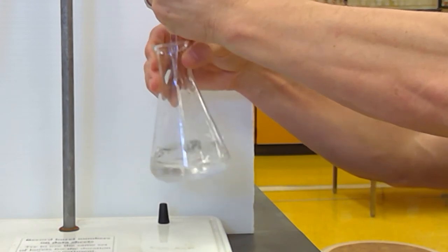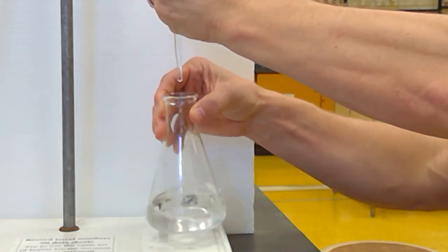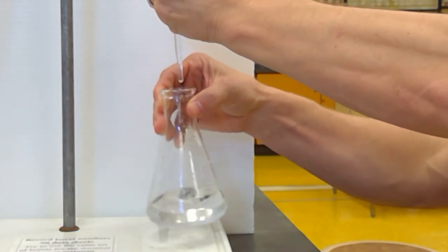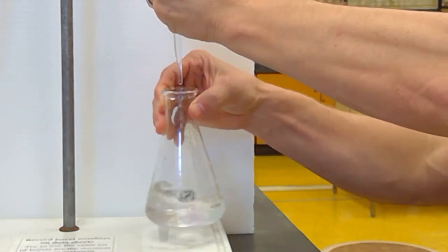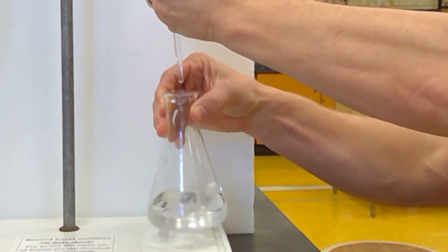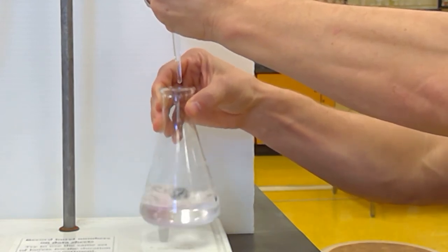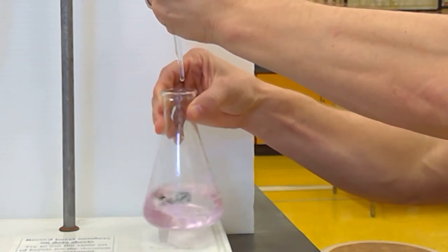And swirl it. I'm just going one drop at a time. I don't know if you can see. I normally don't have the burette outside of the flask. I have it inside the flask, but I want you to see I'm just going one drop at a time here. And I want to get it to where one drop turns this pink. I'm not worried about hitting the end point here.